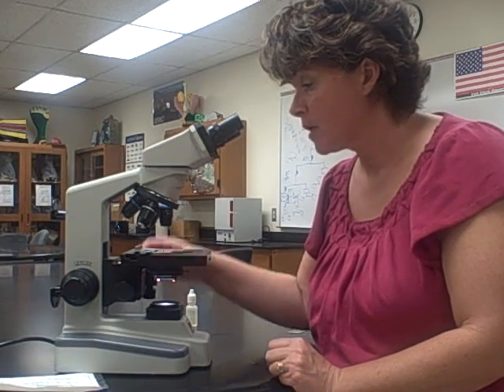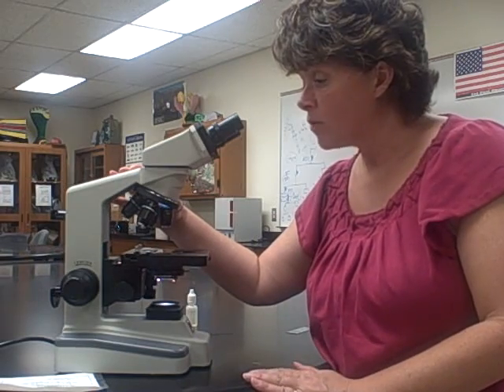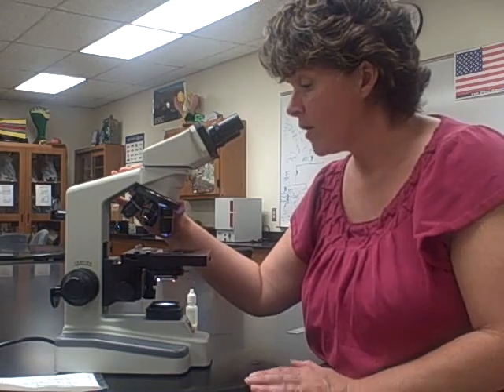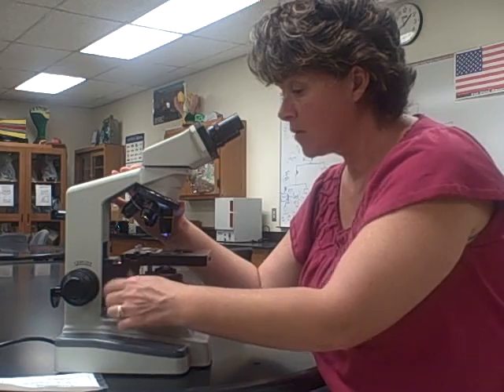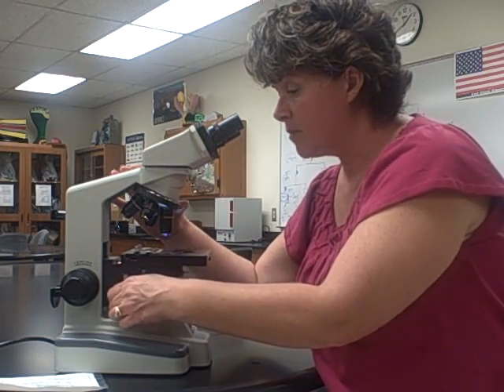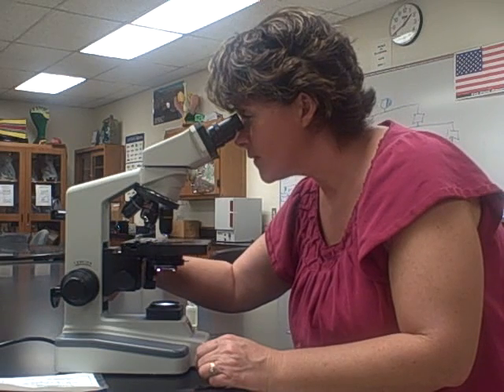Because we're going to be viewing bacteria today and through most of the classes, you don't even need to worry about the 4x objective — the bacteria are just too small and not really going to look like anything. We're going to start with the 10x objective. This is the condenser right here, and as I move this knob the condenser moves down.